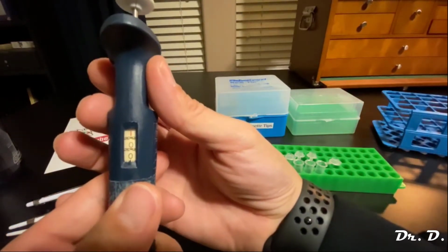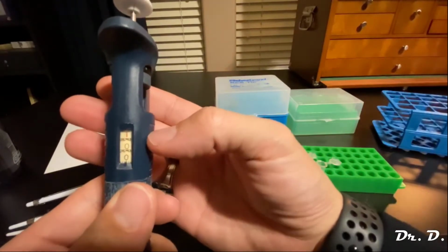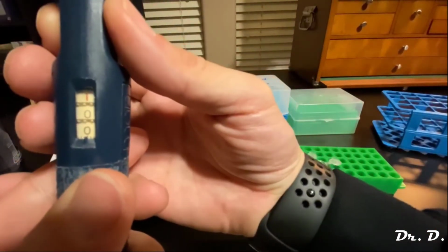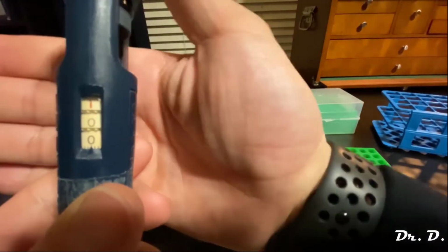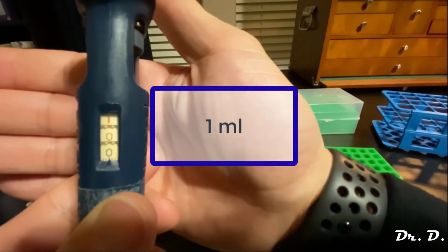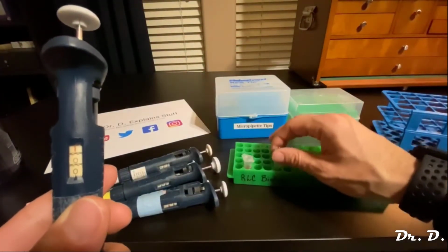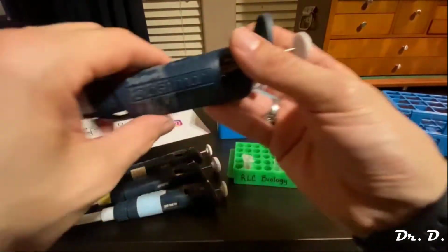So right now, what is it set at, do you think? What do you think it's set at? Well, it's actually a little bit off. Let me get it perfect. There we go. It's actually set at 1,000 microliters, which is what? A milliliter. So is that how much I wanted to transfer to my tube? No, I wanted to transfer 500, right? So can I do that?